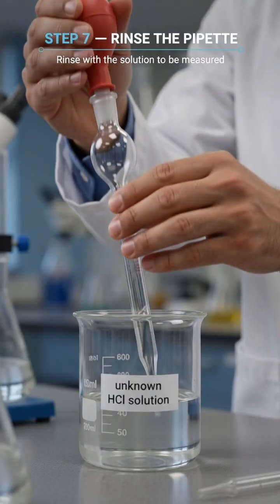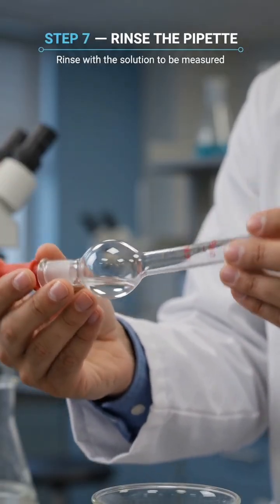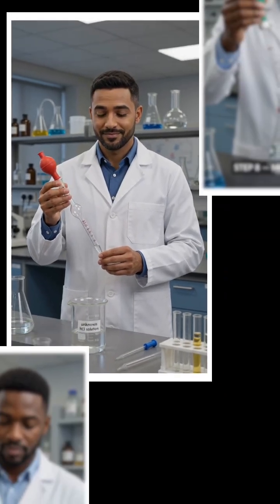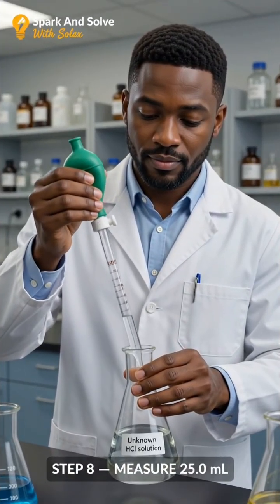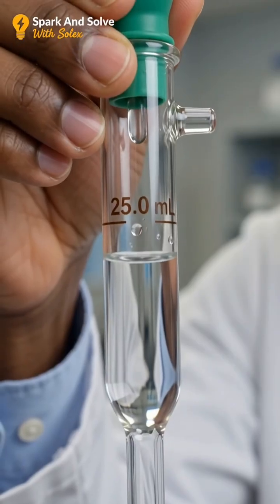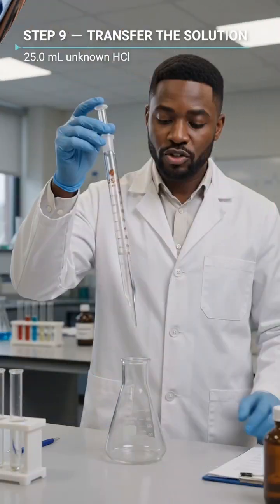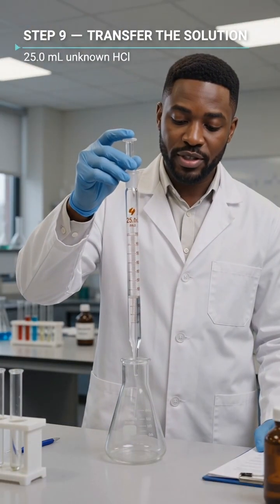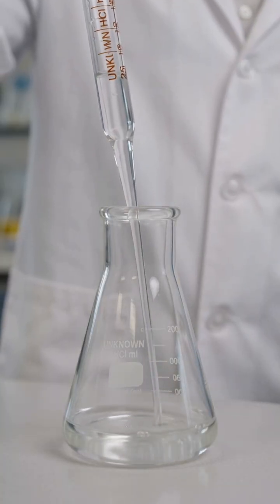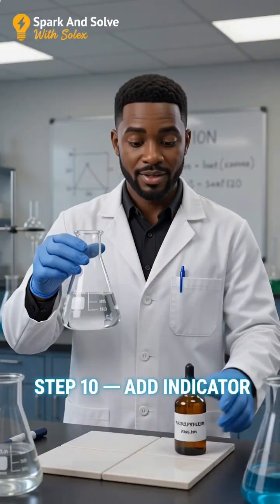Next, rinse the pipette with a small portion of the unknown solution. This prevents dilution when the measured sample is transferred. Now use the pipette to measure exactly 25.0 milliliters of the unknown solution, aligning the meniscus with the calibration mark. Transfer the 25.0 milliliters into the conical flask. Allow the pipette to drain naturally without blowing out the remaining drop.